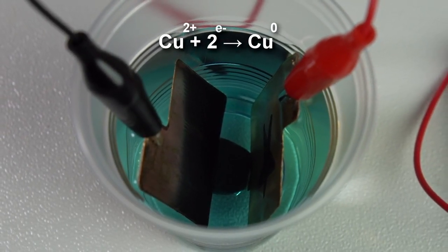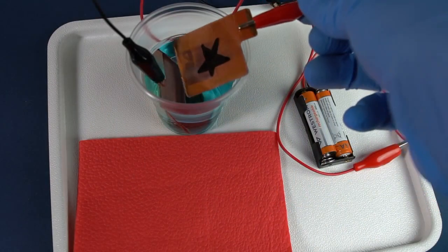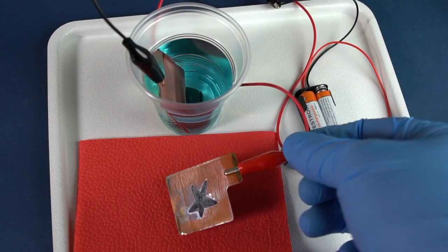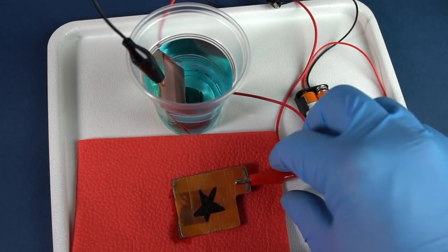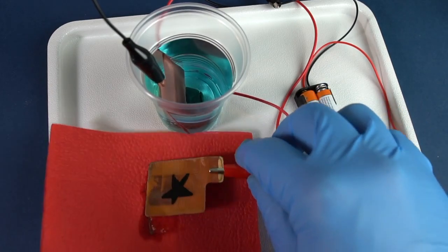On the first plate, copper dissolves over the surface that is dipped into the copper sulphate solution, except the part with the image, because the marker does not let the copper atoms contact with the solution.